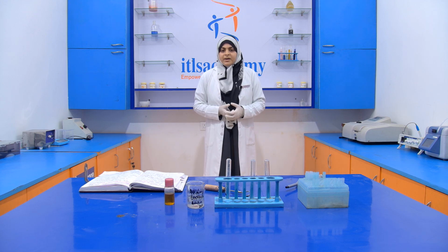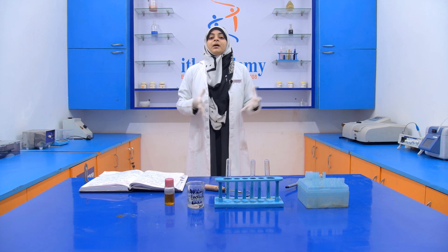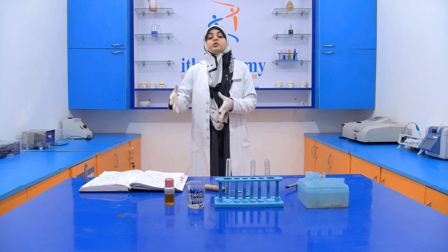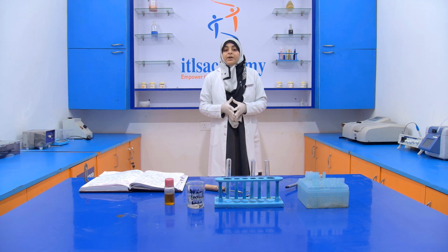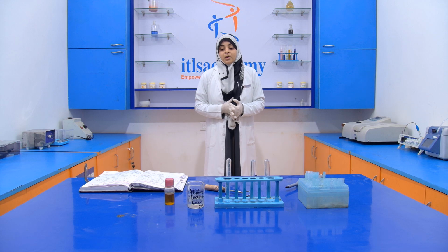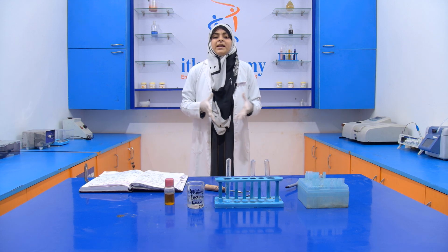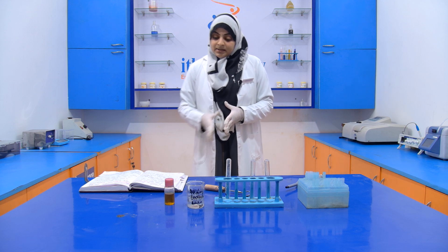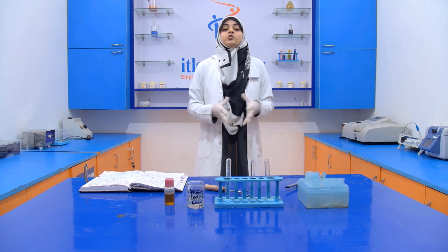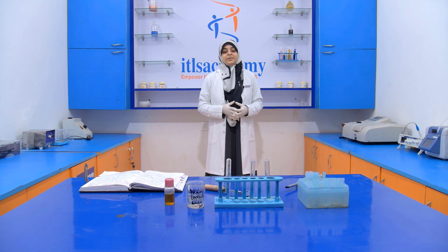Okay, sometimes chemical compounds are added like a preservative, and sometimes we add something as a food ingredient, but it is not part of that food product, and it degrades the quality of the food product. Okay, so this Karanjia oil is bitter in taste and has a pungent aroma. That's why it is not allowed to be mixed with cooking oil or edible oil.